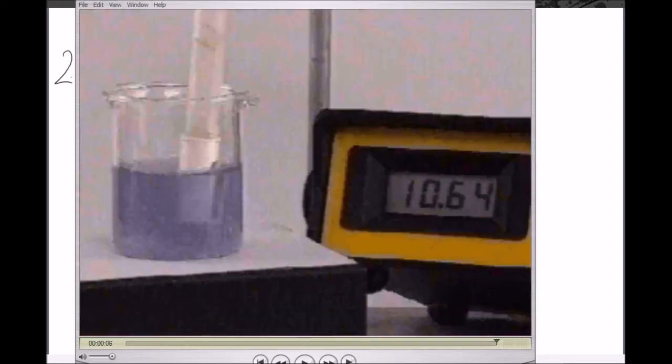So that's rubidium. You can see highly explosive, and that demonstrates the trend that the group 1 metals become more reactive again as we go down the group. So we'll show you that one more time, and the fact that it explodes with impact on water. So it doesn't really have time to float or dissolve or change the universal indicator colour or anything like that. Okay, so quite clearly even more reactive.